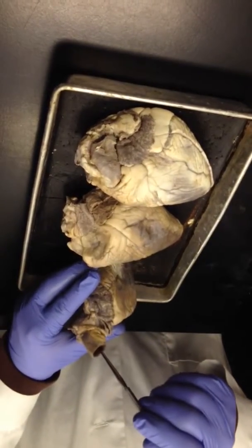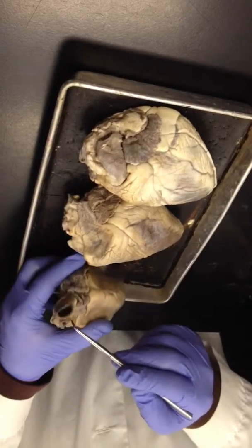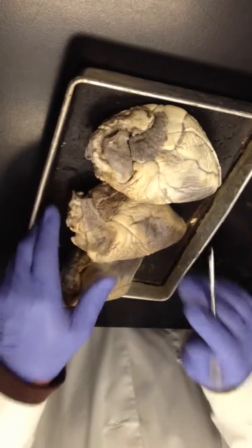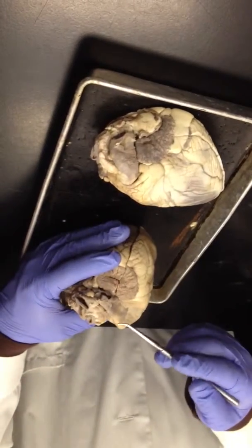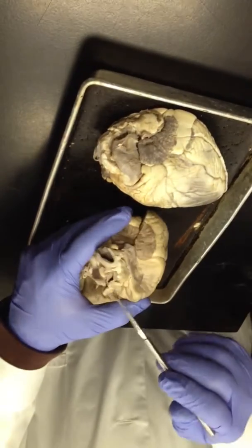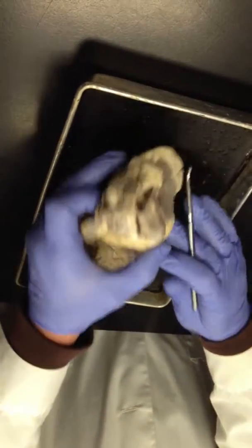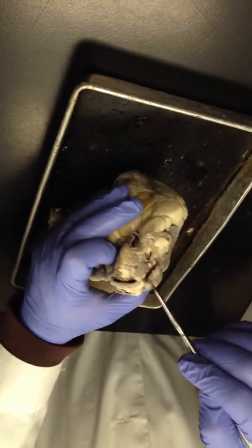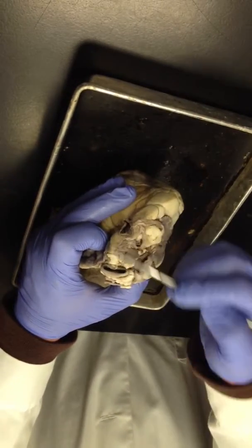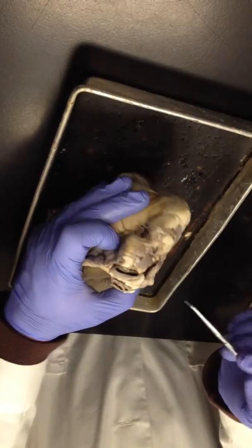And this branch right here, this opening, is the first branch off of the aorta. Aortic arch is called the brachiocephalic branch. On this heart, that's the pulmonary trunk, but this is the aorta, that big opening, and this is the brachiocephalic off of it. On this heart, this is the pulmonary trunk, right here. This is the aorta. You kind of see it's already arching backwards. And this is the brachiocephalic off of it. All right?